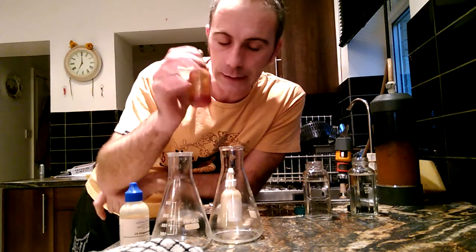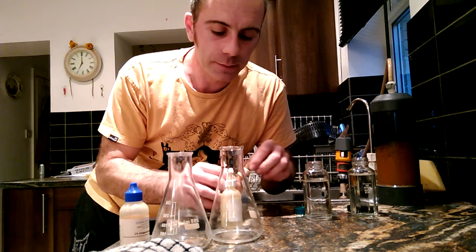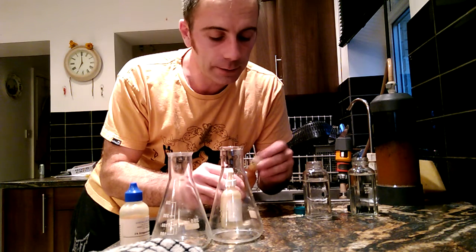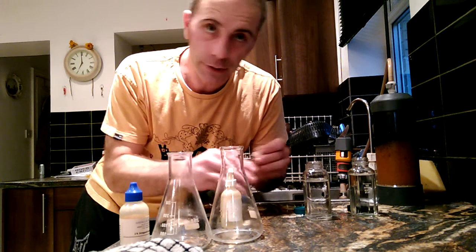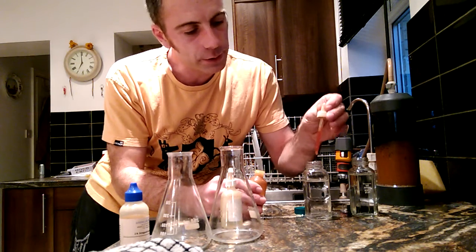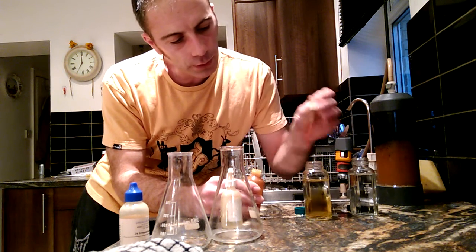Now to perform the precipitation test, we have to add two chemicals to it. The first one being quinoline. Quinoline — I'm sure many of you have heard of — is used as a food dye nowadays, it was still in malaria tablets and used as a medicinal substance many years ago, but basically widespread use as a food dye nowadays. In this instance it's going to dye all the water and all the impurities in there.